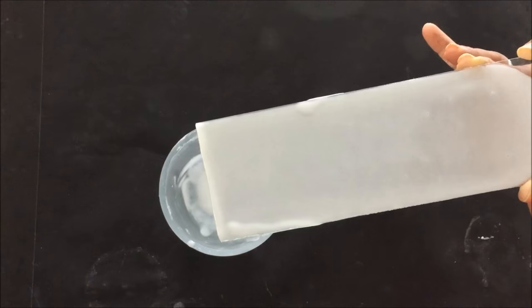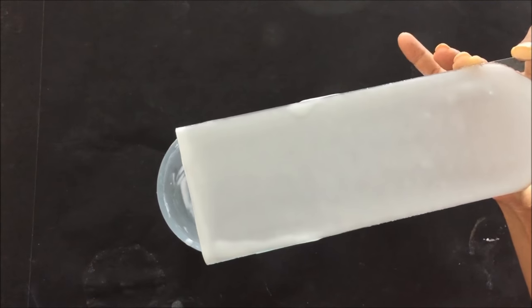After uniformly coating the slurry, then dry these plates at room temperature.